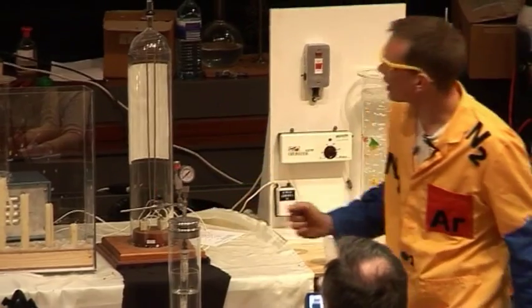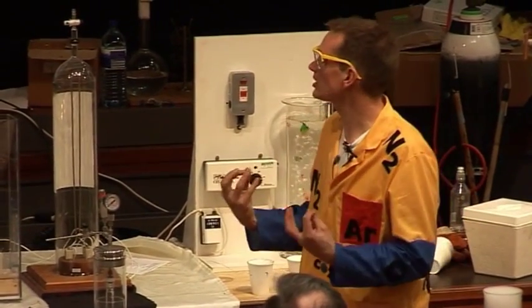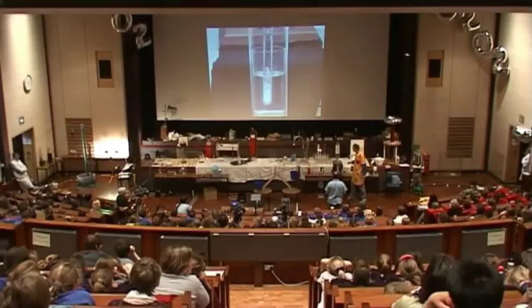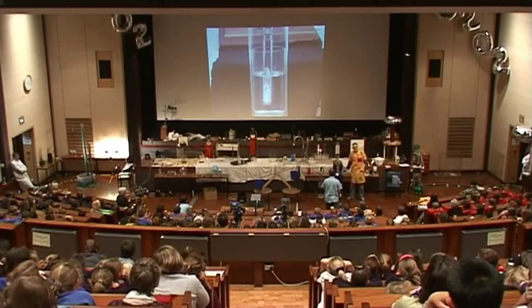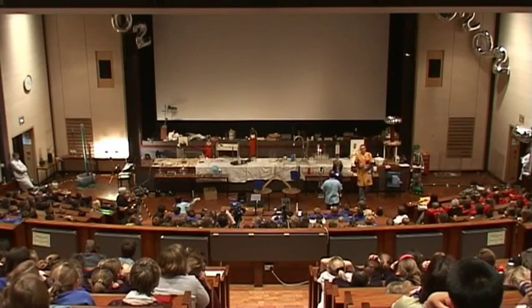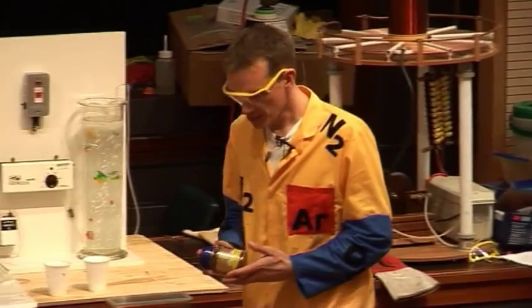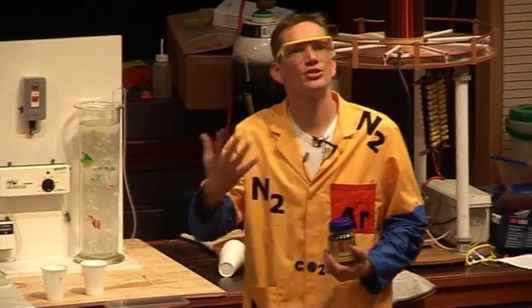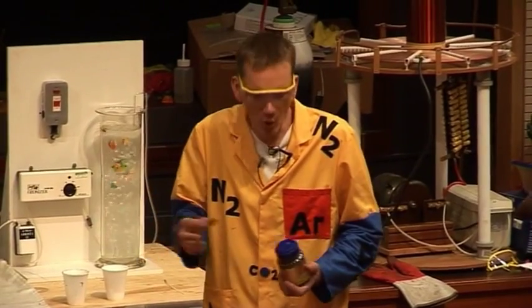Now I'll close it off again, and that will help it melt again as the pressure builds up, and the whole thing will do it again. This liquid carbon dioxide is actually really useful because we can use it to dissolve things that wouldn't normally dissolve in water.